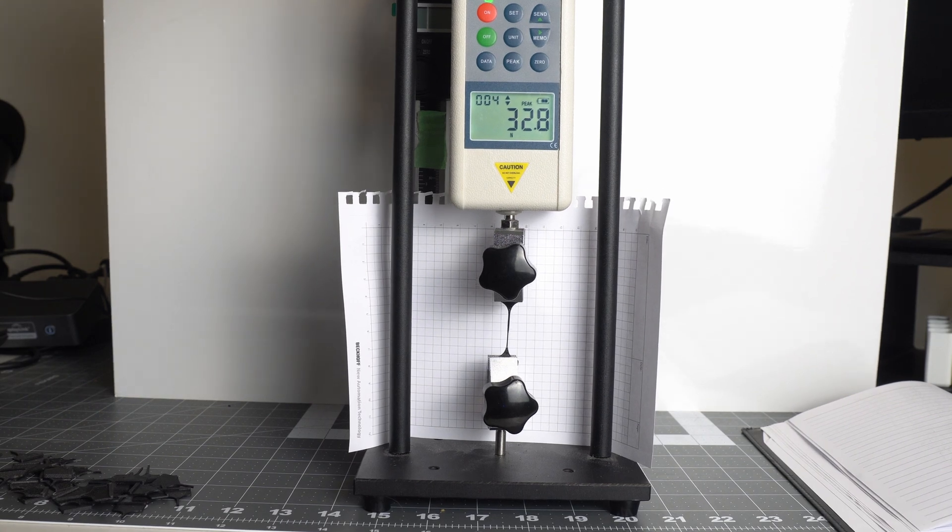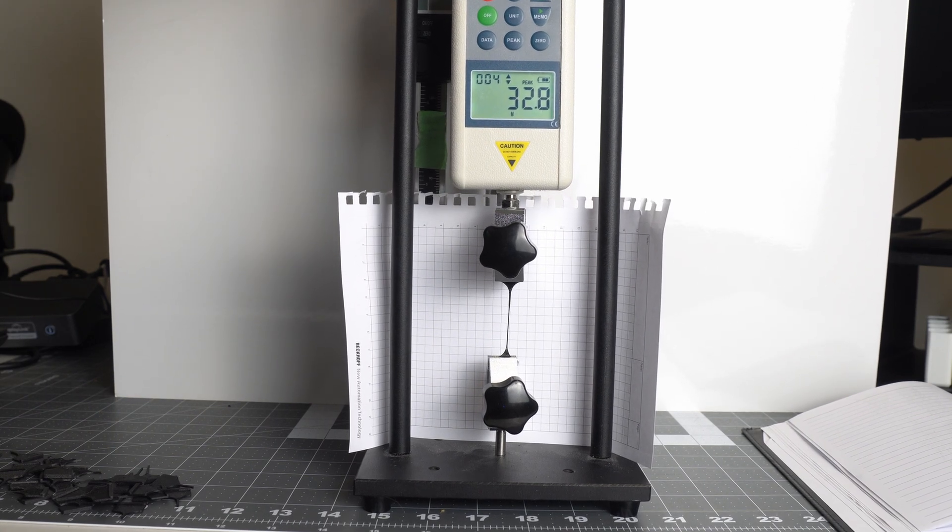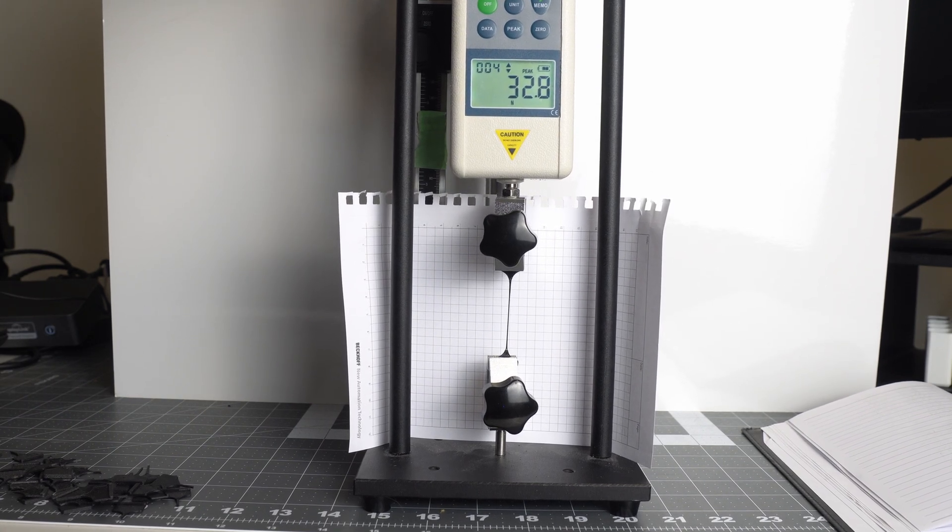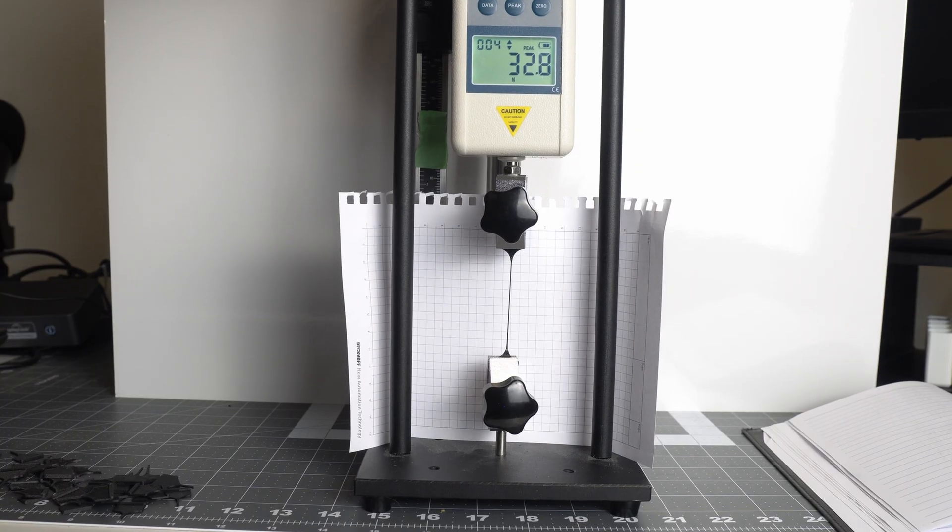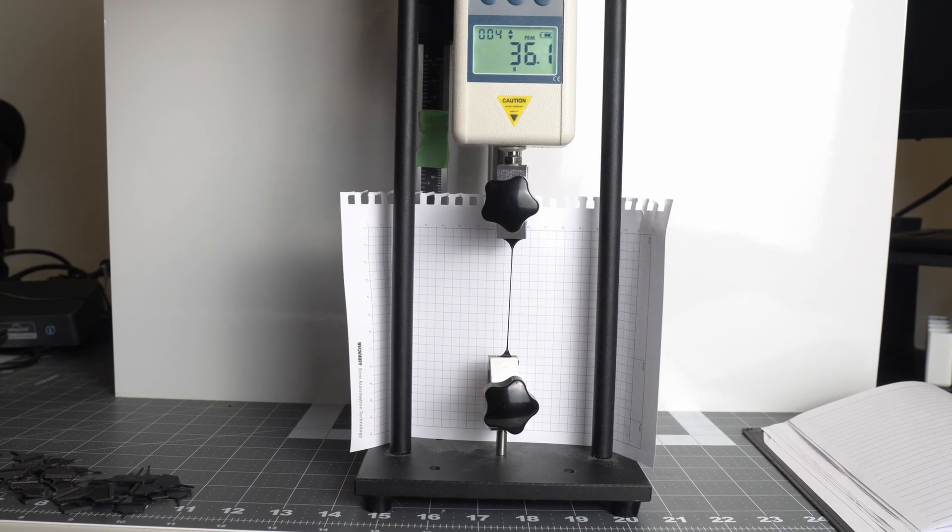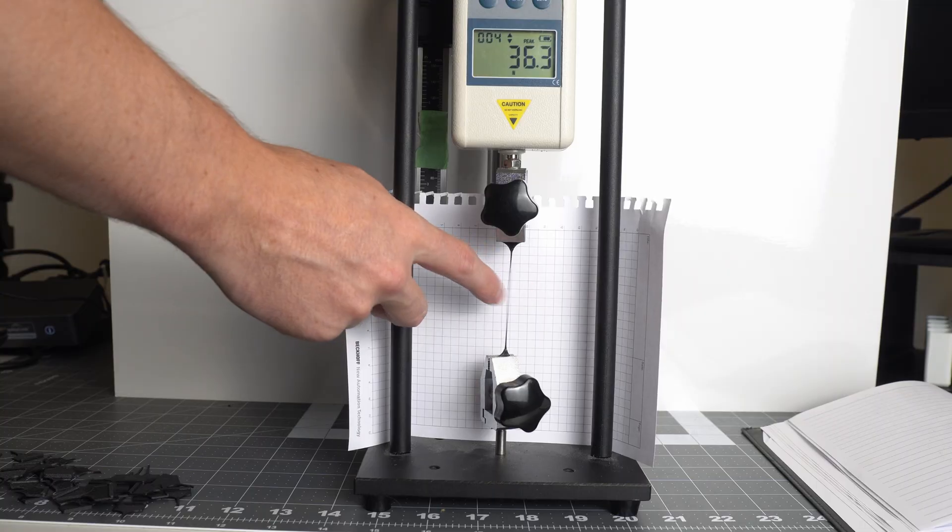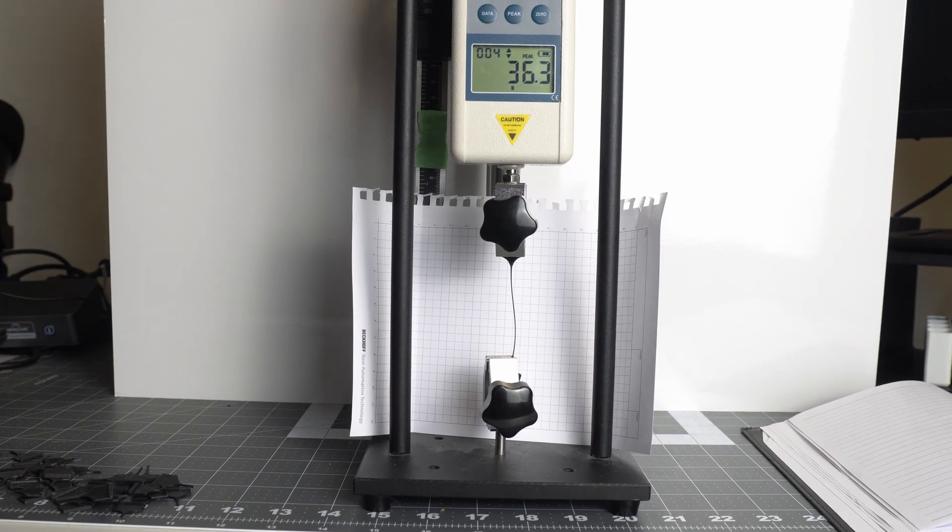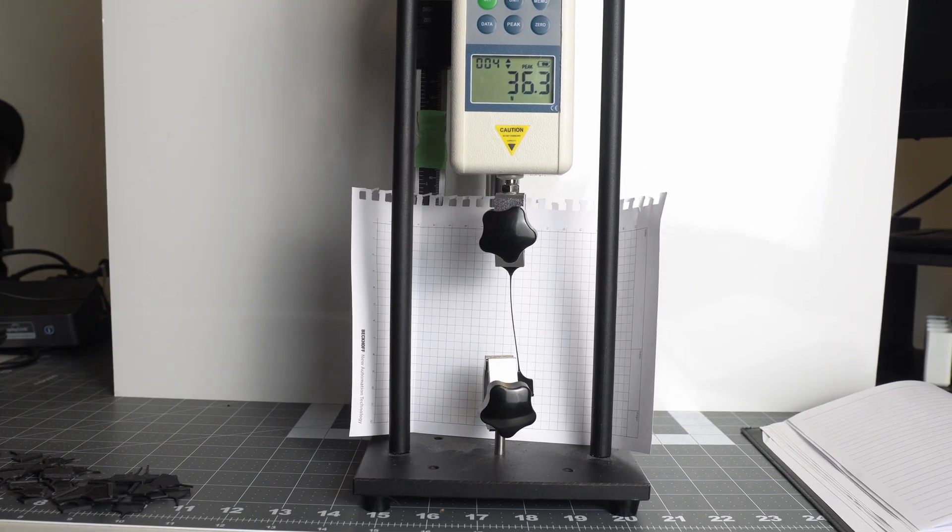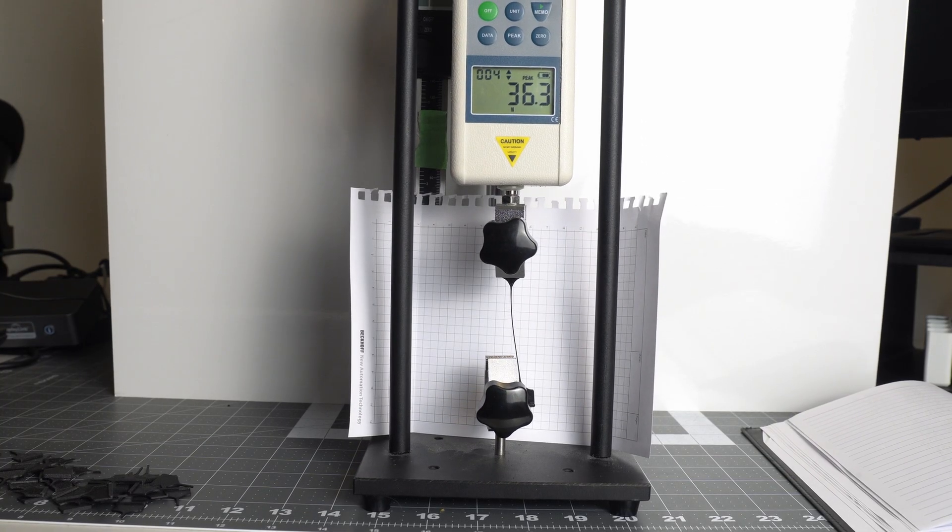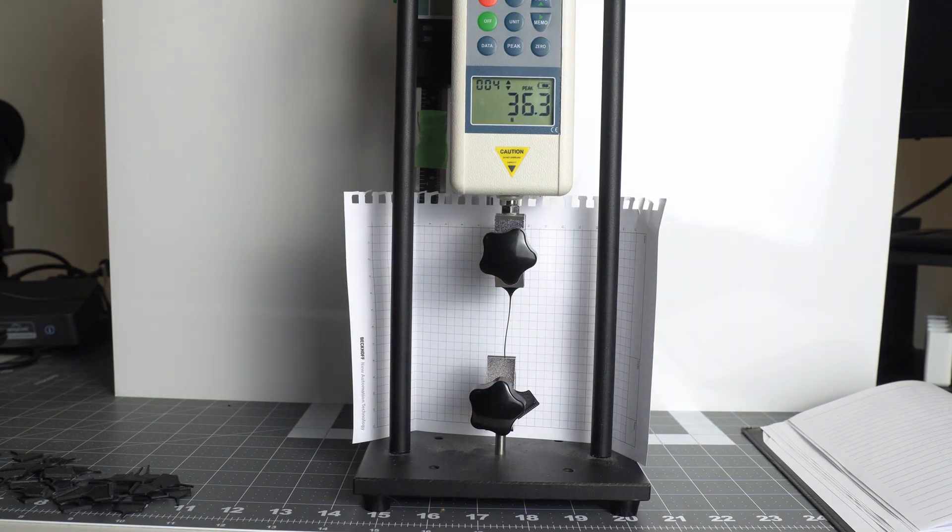Here's the Easy PA which is very ductile and stretched a lot before breaking. It actually stretched past the limits of my tensile gauge. I had to unclip it and then tie it back down so that it would actually snap and I would get the full reading out of it.